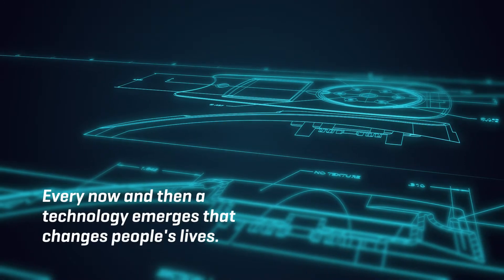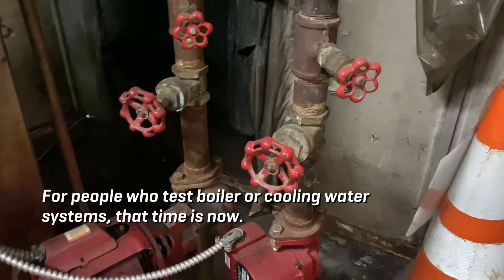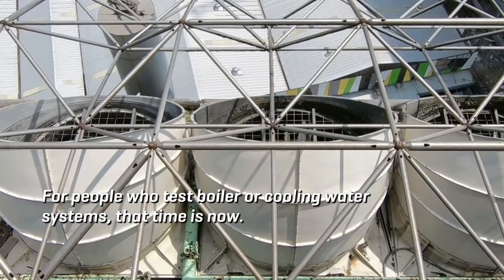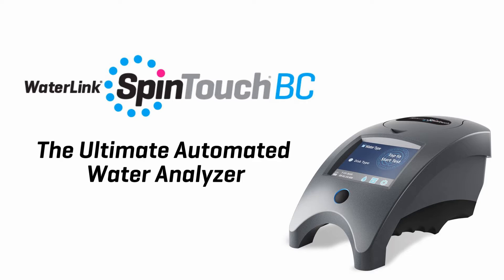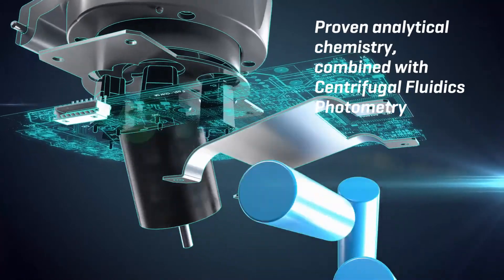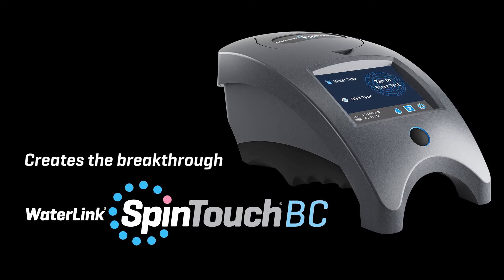Every now and then a technology emerges that changes people's lives. For people who test boiler or cooling water systems, that time is now. Introducing WaterLink SpinTouch BC, the ultimate automated water analyzer. Proven analytical chemistry combined with centrifugal fluidics photometry creates the breakthrough of WaterLink SpinTouch BC.